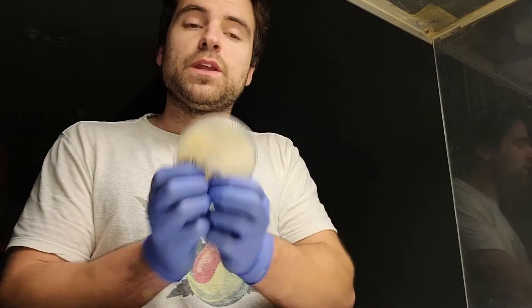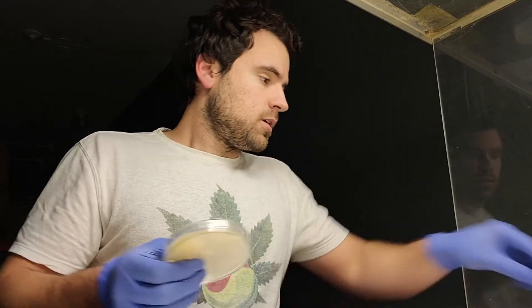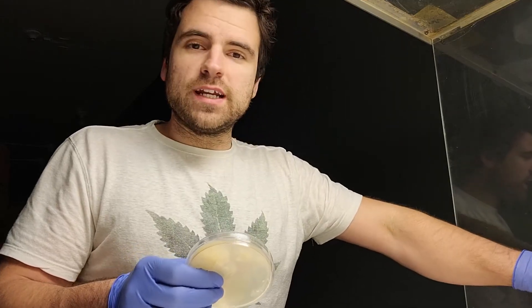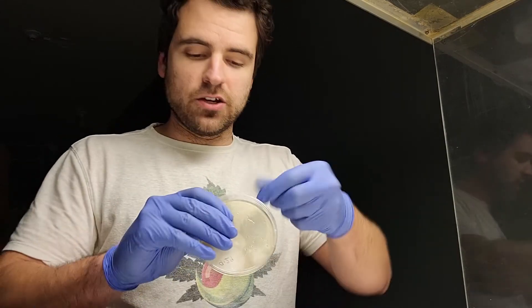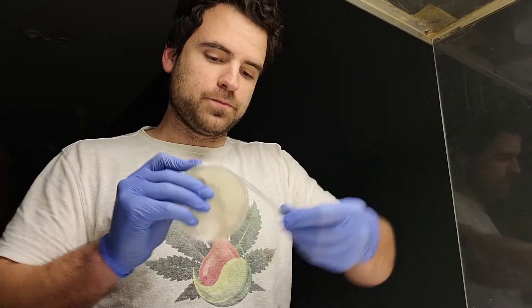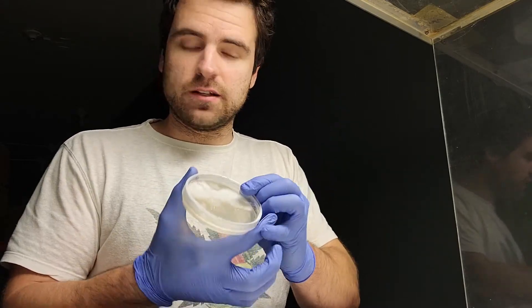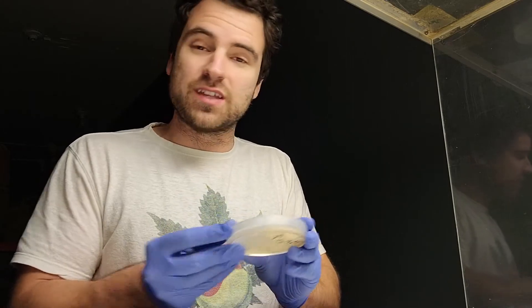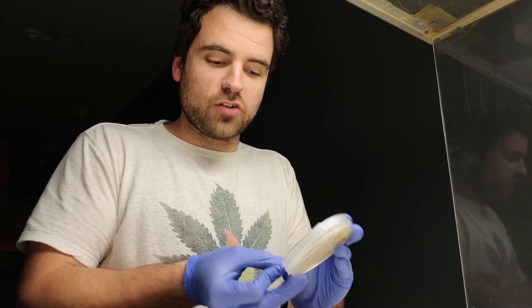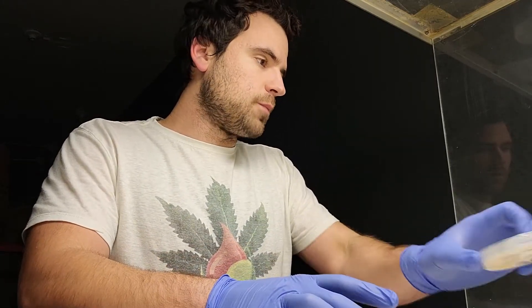I'm going to throw this away because I know I don't need it — I already have a clean culture so I'm not at risk of losing anything. If this was your only plate I wouldn't throw it away; keep it just in case something happens with these new ones. But I'm throwing this away.